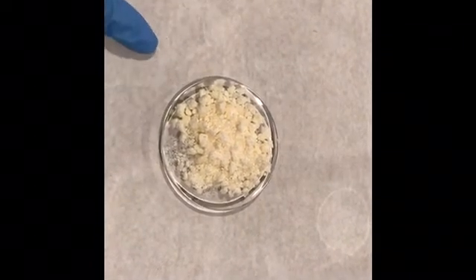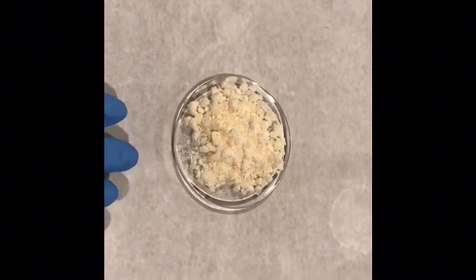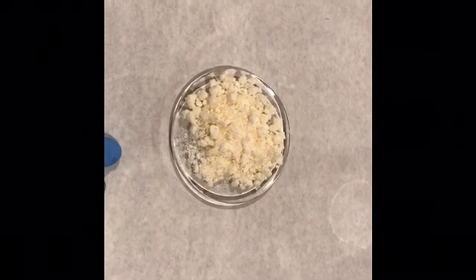Since the melting point indicates a pure compound, I am not going to recrystallize it and I am not continuing to experiment 34b, where you would need very pure benzoin to synthesize benzil. This is the synthesis of benzoin. You can calculate the percent yield based on your theoretical yield — write the pre-lab with a table of reactants and products, then calculate the percent yield in the report.